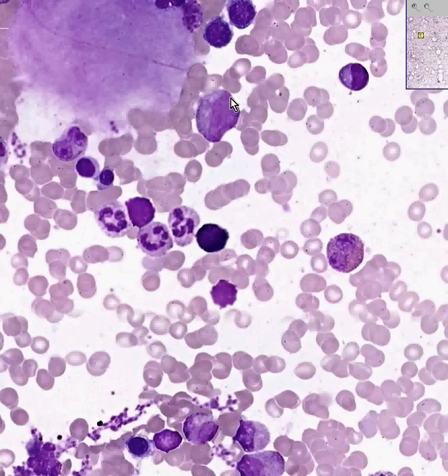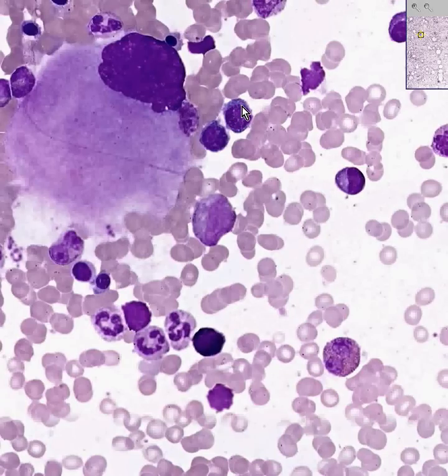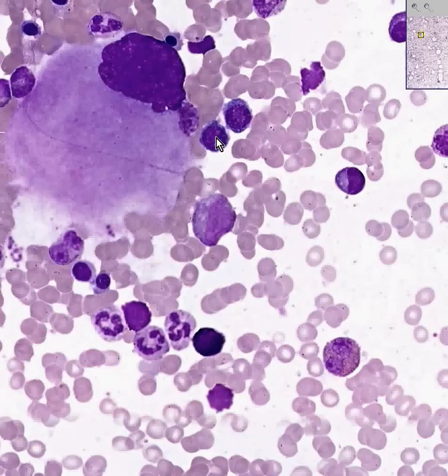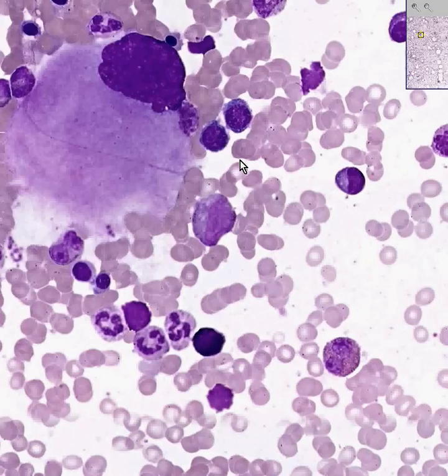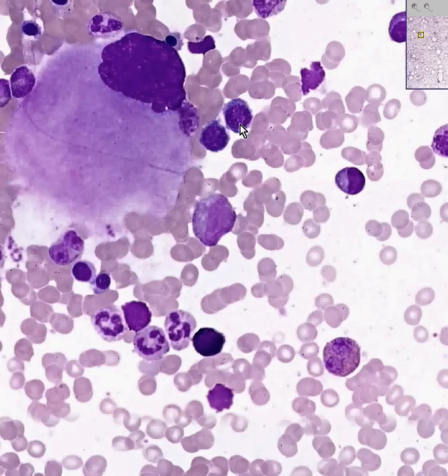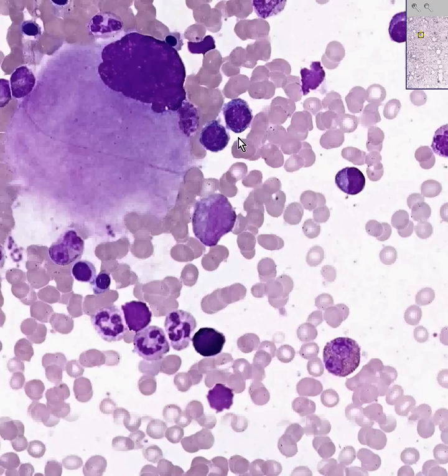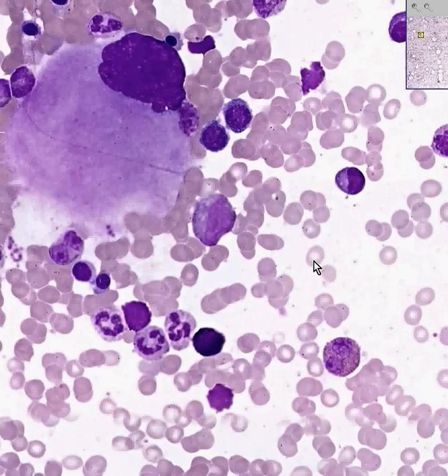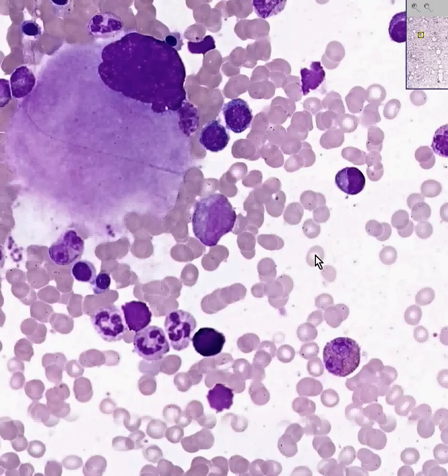The cells which have a round nucleus and a very dark blue cytoplasm are the precursors to the red cells. These are called normoblasts. They generally mature from very large cells with a lot of cytoplasm to very small cells in which the nucleus is eventually lost, and a mature red cell is then produced.